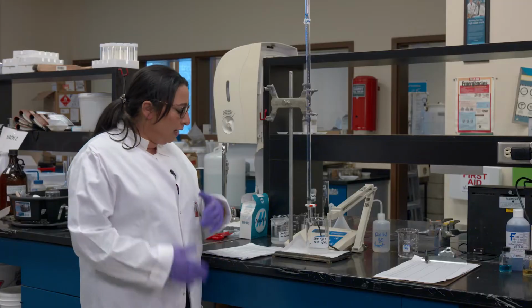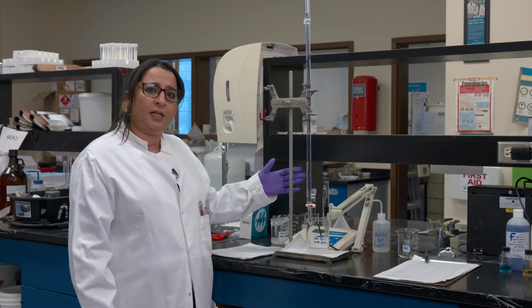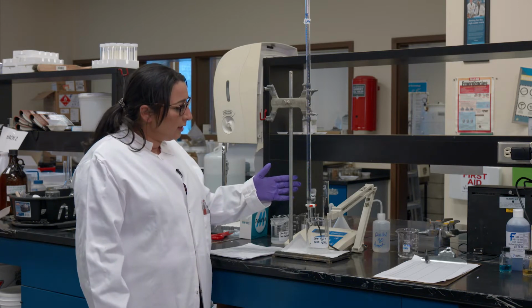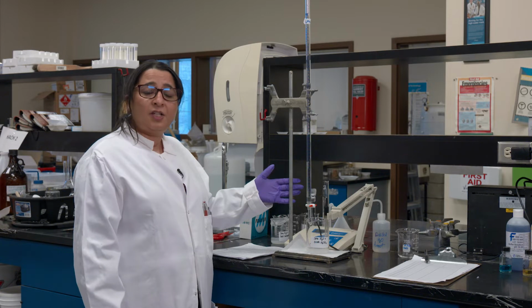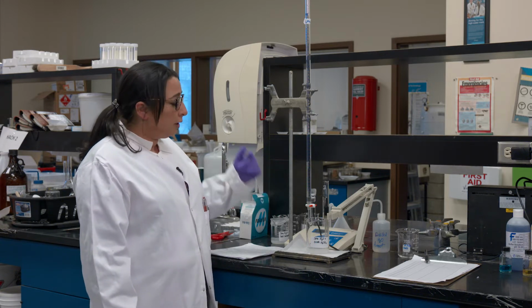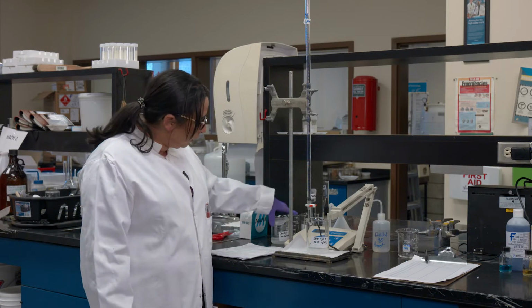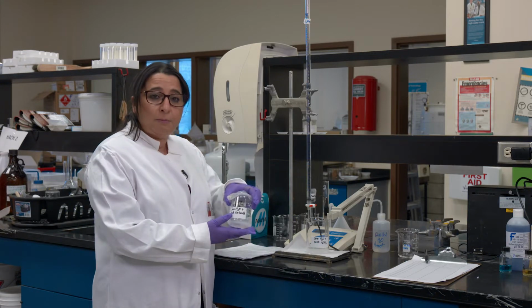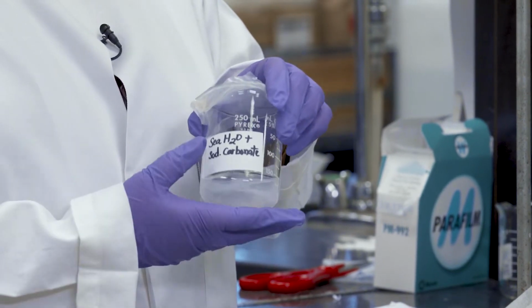So now here we are. I'm just going to point toward the experiment that you will be involved in. This is a titration. Well, yes, of course, there's a burette. So we will be doing a pH titration. Today, for the titration, we will be using an artificial seawater solution that has been prepared in the lab. It's not from the ocean, but we prepared it in the lab.